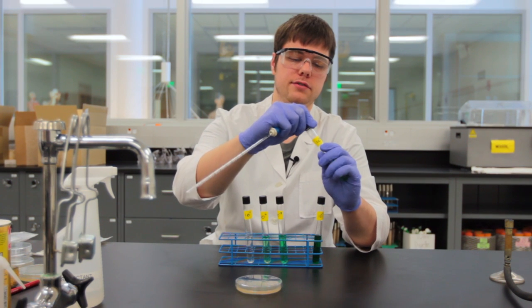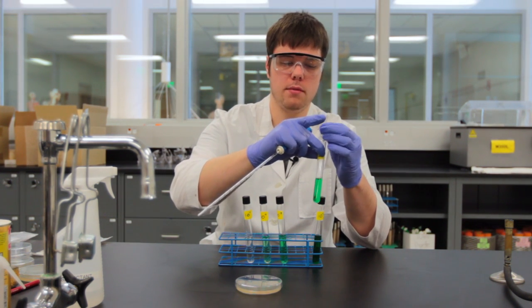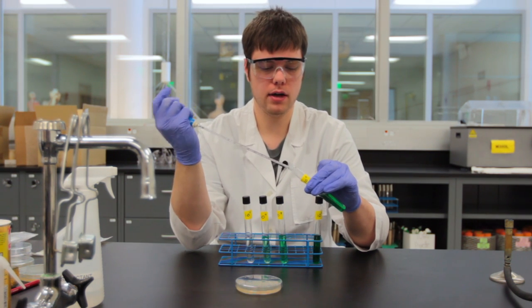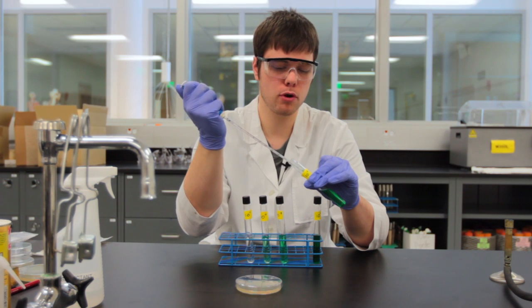I've got my 10 to the negative 2 dilution, I'm going to open that aseptically, and my lab manual tells me that I need to deliver 0.1 mil as should yours. If not, make sure you follow it appropriately.